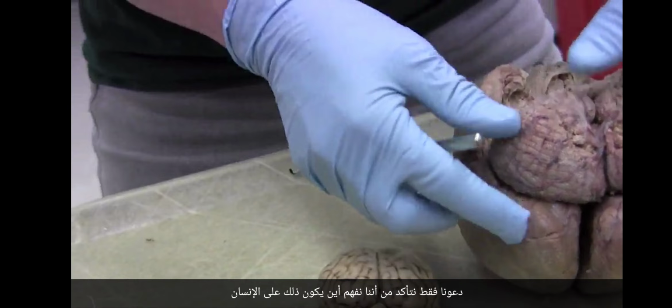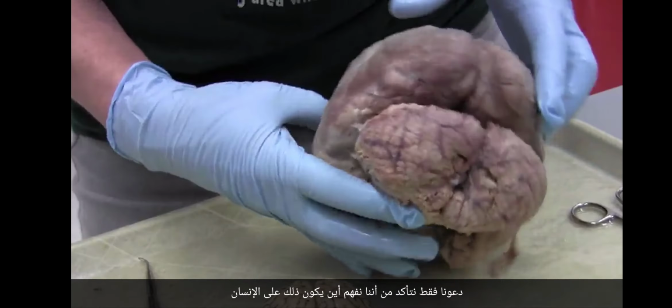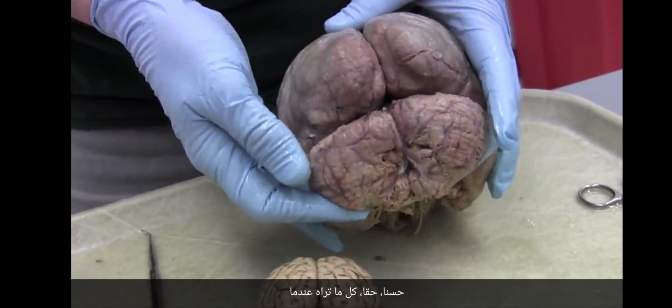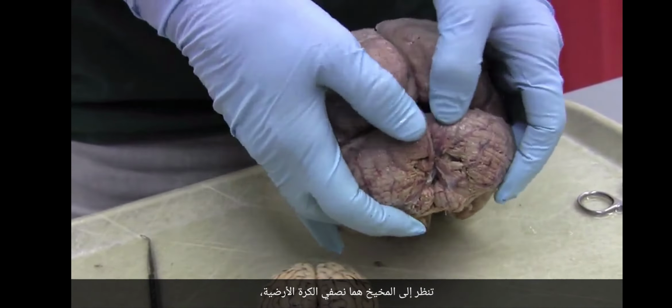Let's just make sure that we understand where that is on the human. Well, really, all you see when you look at the cerebellum are the two hemispheres, because they have expanded to cover up the vermis, which is right inside of there, underneath there. There's the vermis.